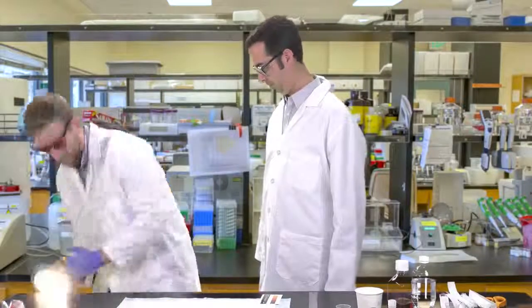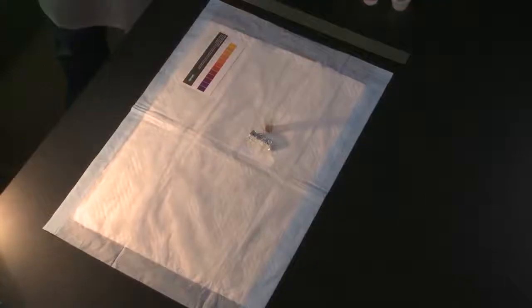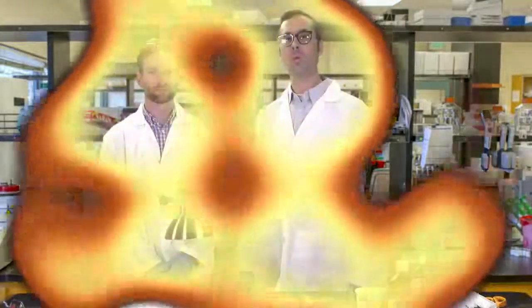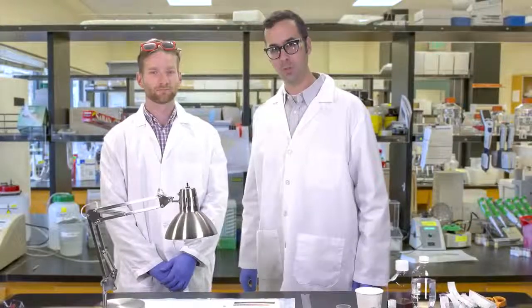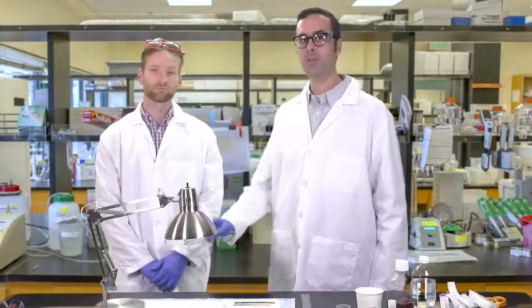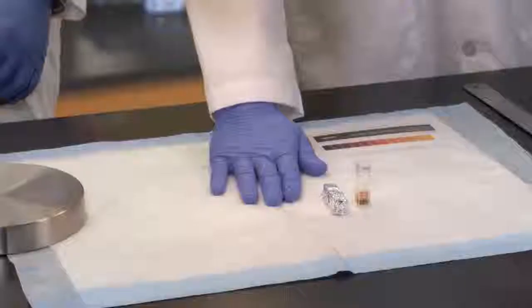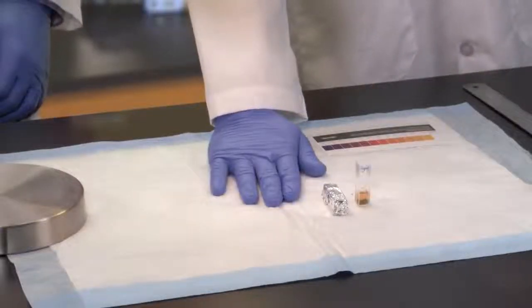All right, I got a great idea. Let's get these puppies cranking. Easy, tiger. There's a couple of things you need to keep in mind before you start your experiment. One, the light source shouldn't be too hot or too bright or it will fry your algae beads. If you can feel any heat on the back of your hand, your lamp is too hot.